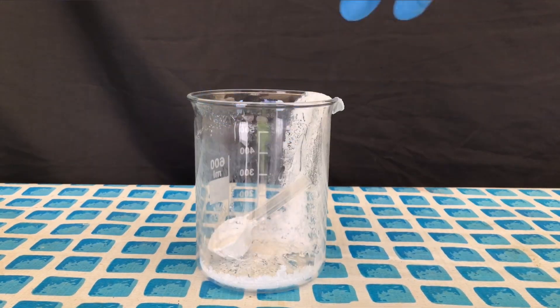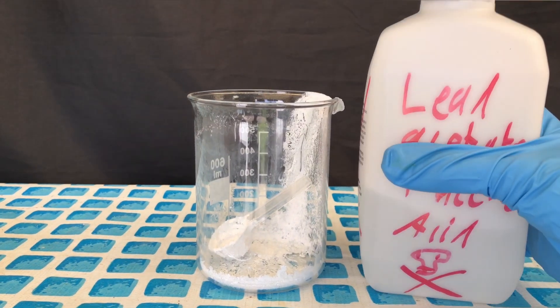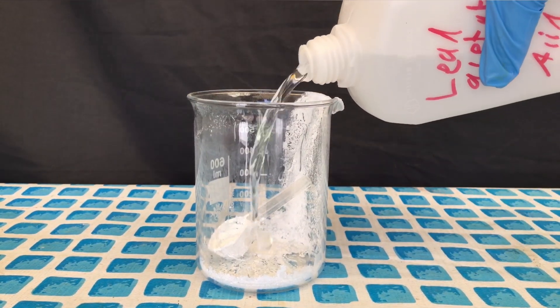The beaker you see right here isn't dirty but it actually contains basic lead acetate, which is still in it because I let it stand for about a month.